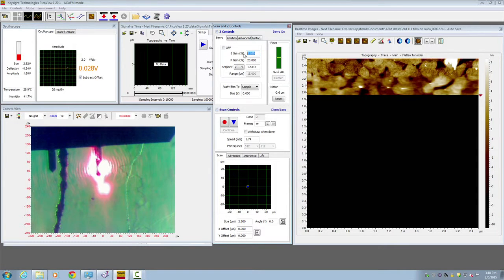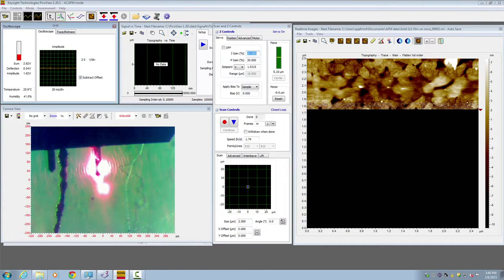Let's change the gain from 2% to 11%, and then let's further increase from 11% to 20%. Now notice the image appears to have a certain vibration noise. If we look at this oscilloscope window, we also notice this vibration noise right here. And this is caused by the integral gain being too high, and therefore the sensitivity is too high, and it causes the feedback loop to oscillate itself.